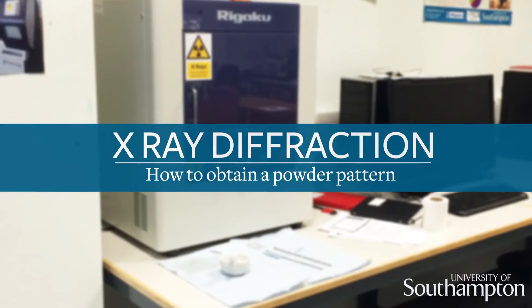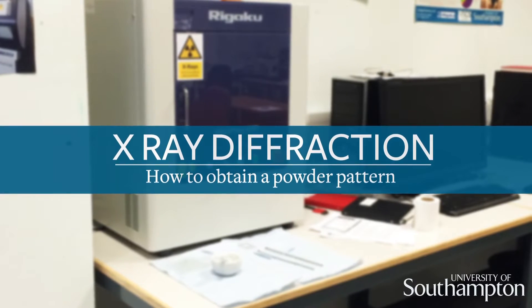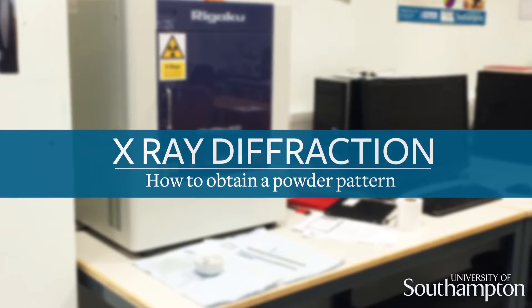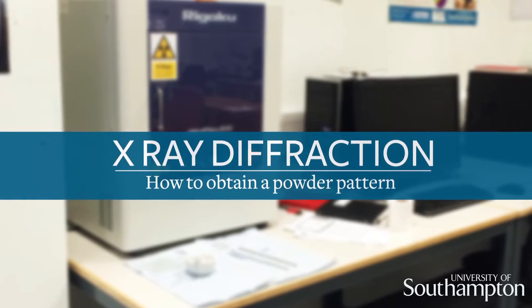This video will cover how to obtain a powder pattern via x-ray diffraction. A powder pattern is a non-destructive technique used for analysis of the bulk material.